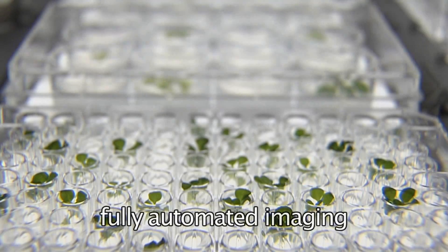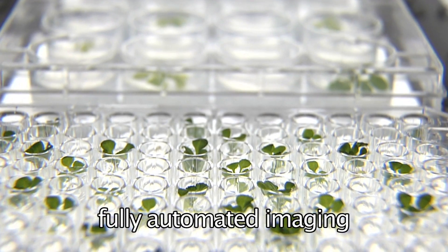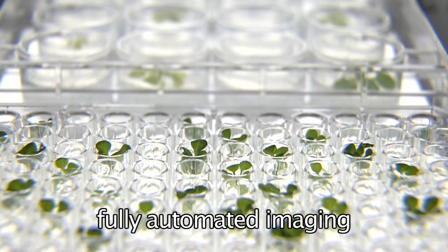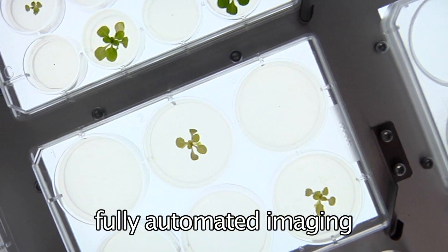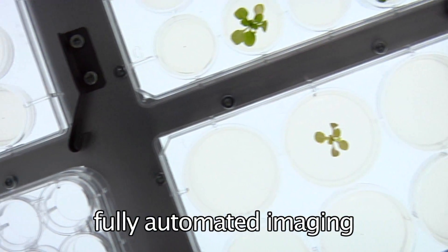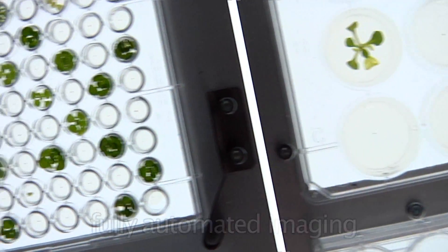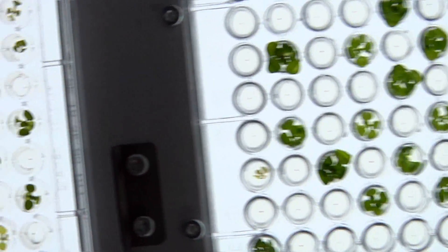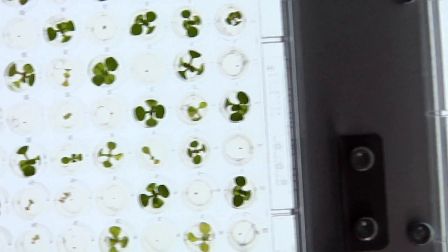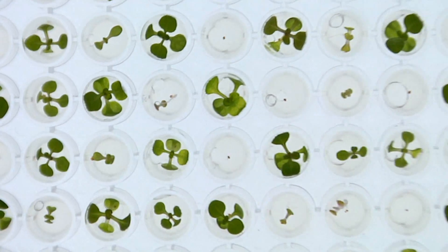The Lemnatec Scanalyzer HTS system may image any of the following test objects: microscopic cell cultures or nematodes in water, microbiological colonies or Arabidopsis seeds, or in fact any other object up to the size of leaf rosettes with a diameter of 10 cm.